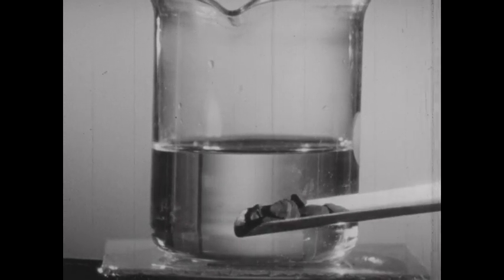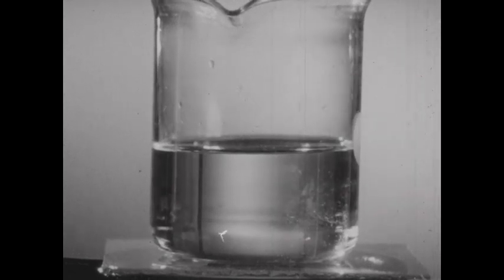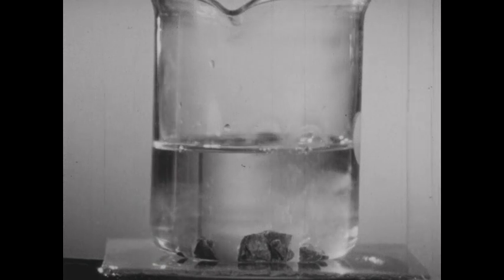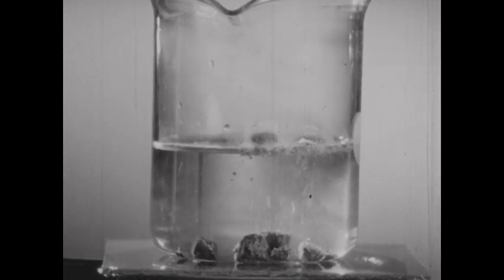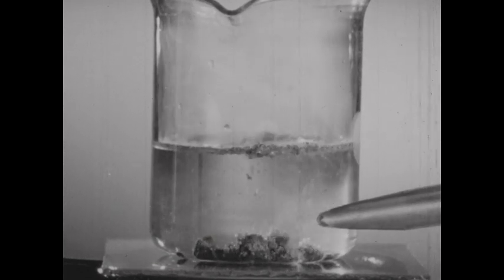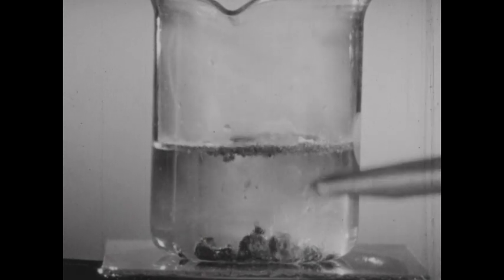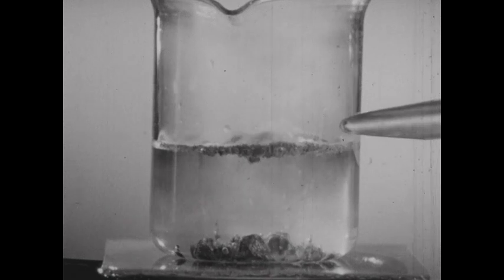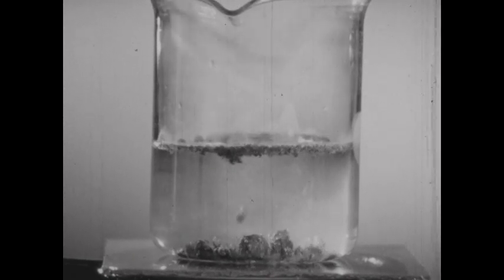Several lumps of calcium phosphide are placed in the water in the beaker. Down here, the calcium phosphide is reacting with the water, forming bubbles of phosphine. These rise to the surface and ignite, giving puffs of flame and producing fumes of phosphorus pentoxide.